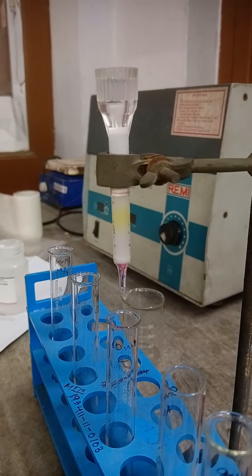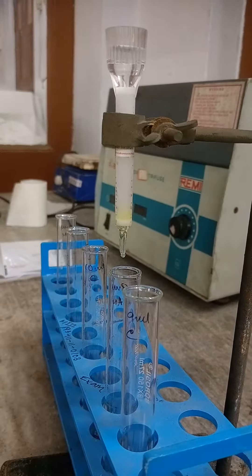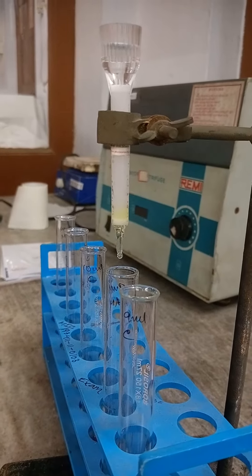This is the last part of the pink section, followed by yellow. Finally, PNP whose molecular weight is 139 dalton is coming out.